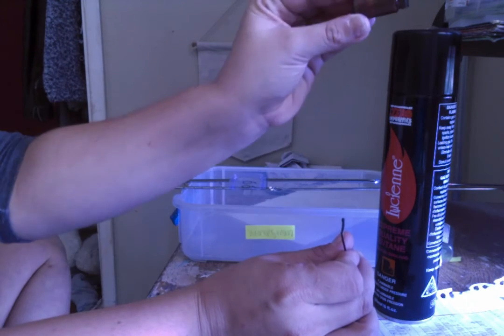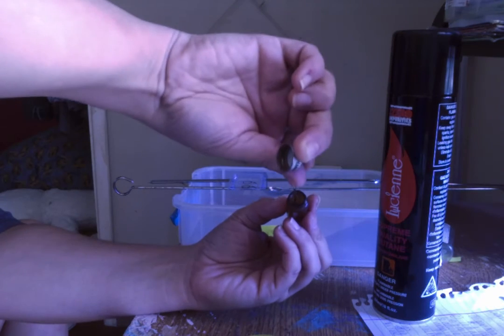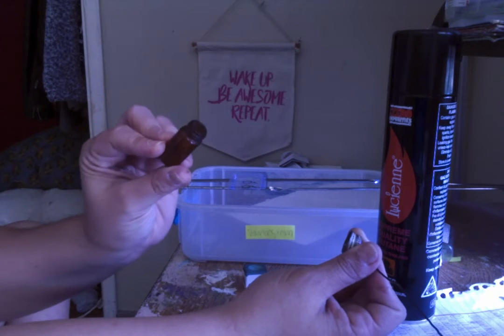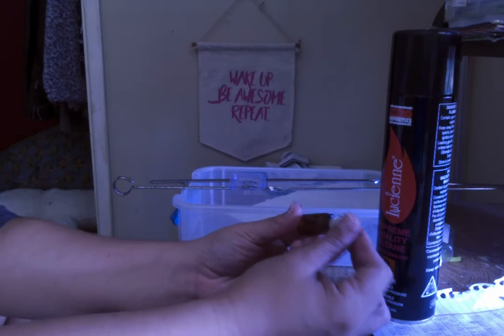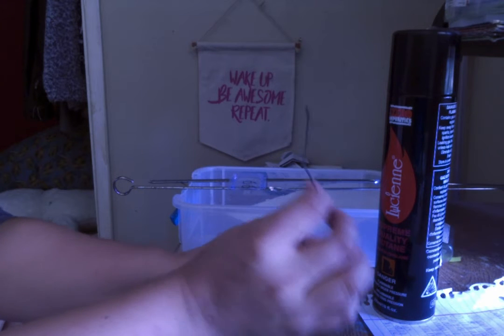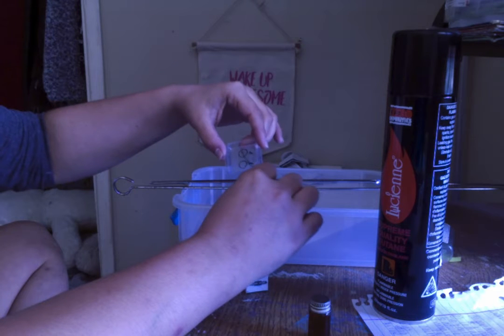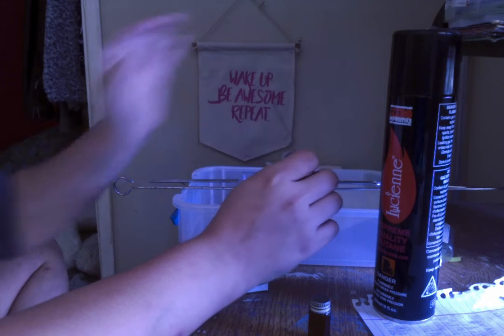And so then you're going to put the lip of the bacteria just a couple of times over the Bunsen burner and then get your sample, put the bacteria lip back over the Bunsen burner a couple of times and replace the lid. Then you're going to want to make a very small, thin smear of the bacteria. And if you can barely see it, that's good. Like, you do not want to overdo it. Less is more in this case.